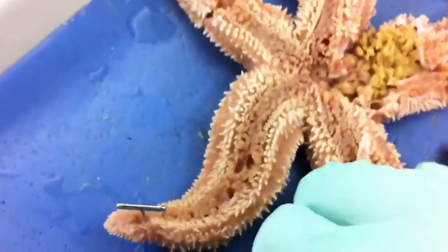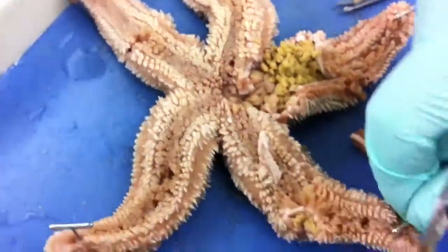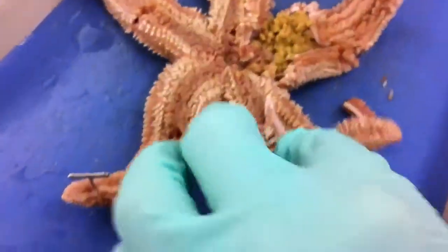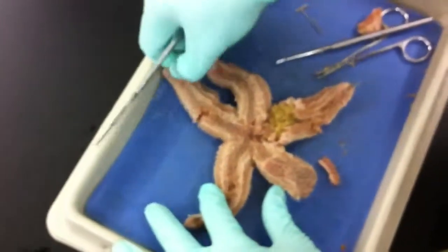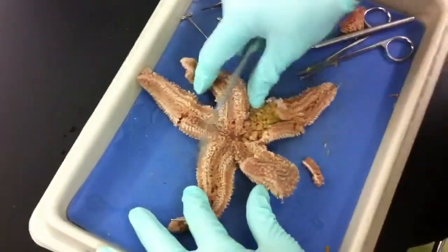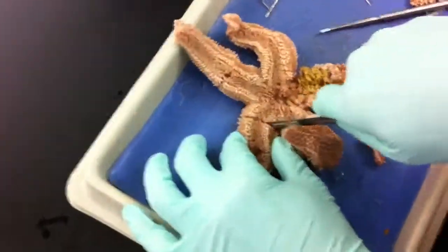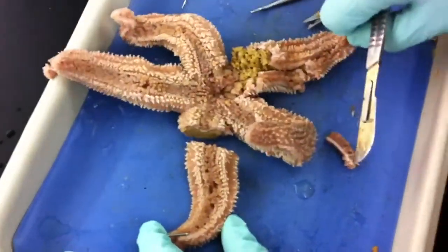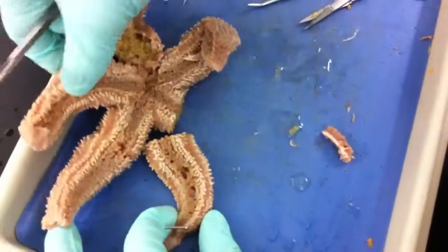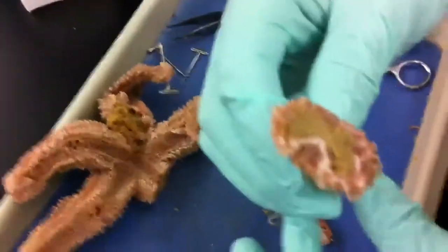Alright, now we're about to just do like the full... moving right here. Take this out, rotate the starfish. I was showing you the finger — you see that? It's kind of like this, yeah it's messed up. Oh, the blade. That's what it looks like right there. I just focus on it. And then you see like all those suckers — it sticks to rocks and stuff.